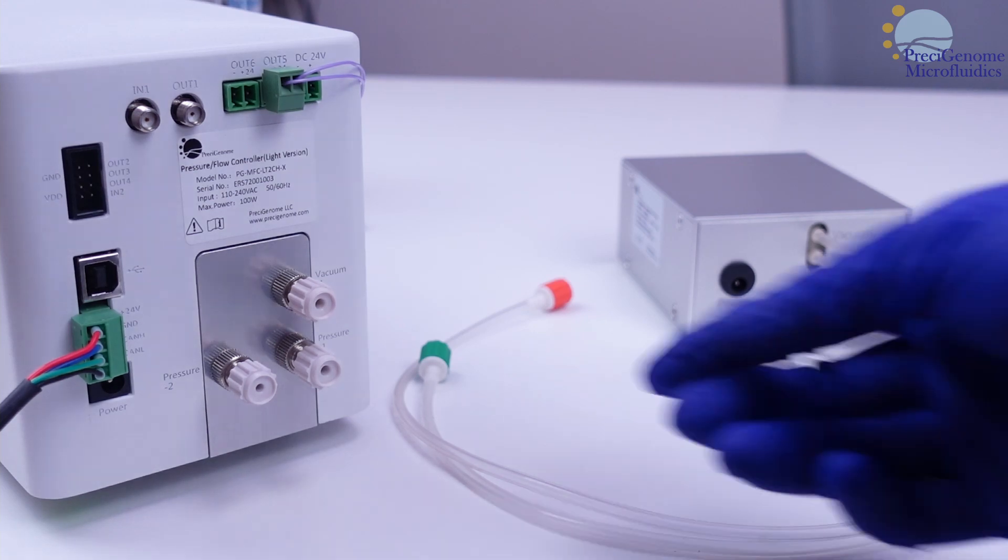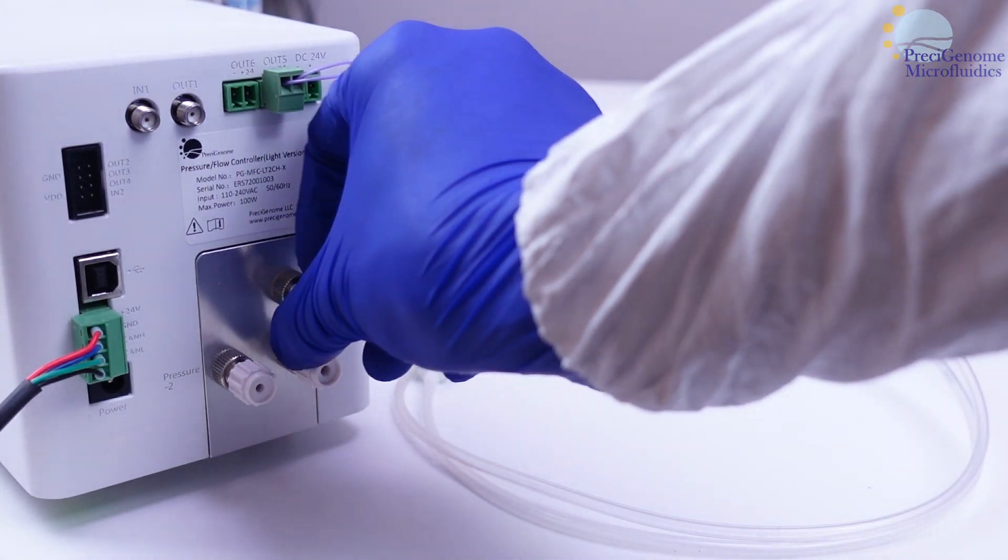The iFlowLite requires an external pump, which connects to it in the rear.